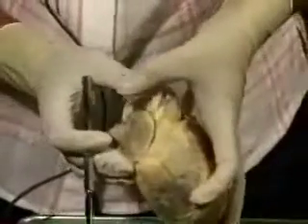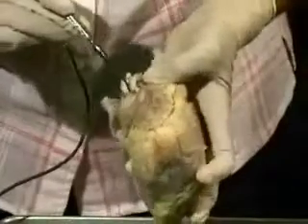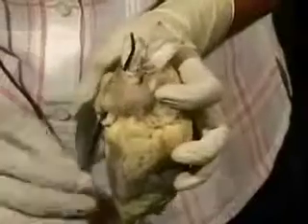I've put this little bit of tissue paper inside to just show you openings. Now in the right atrium, this is the superior vena cava, and here this is the inferior vena cava. So I'm going to pull this down this way and you can see it move. You can see it moving. I'm also going to try and put my probe through to show you how they are continuous here. So you can see that. So this is the superior vena cava, the inferior vena cava, which open into the right atrium.